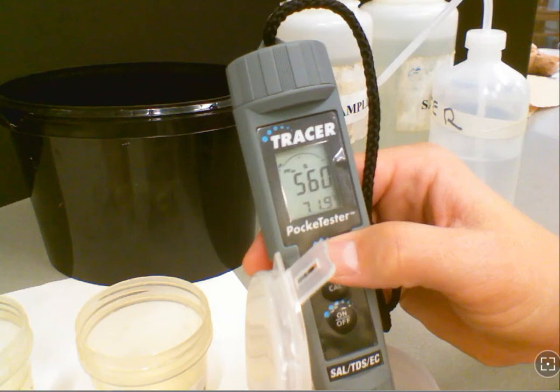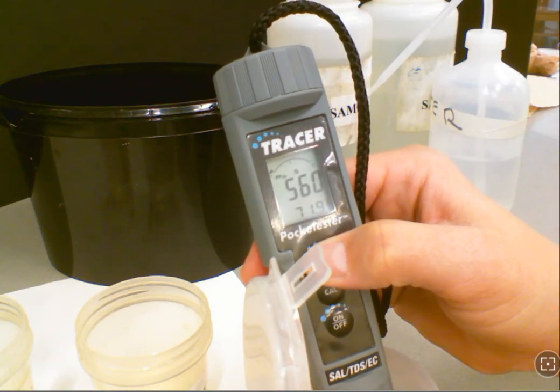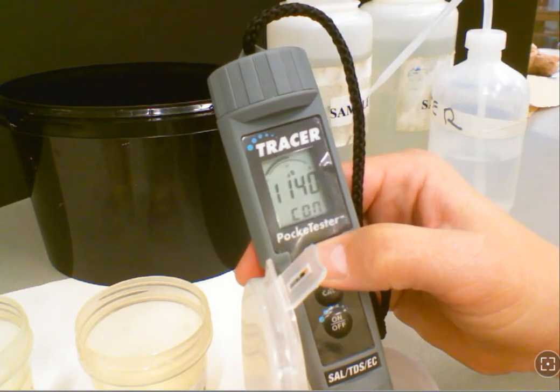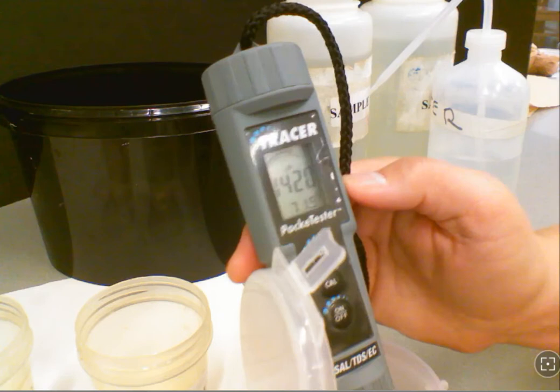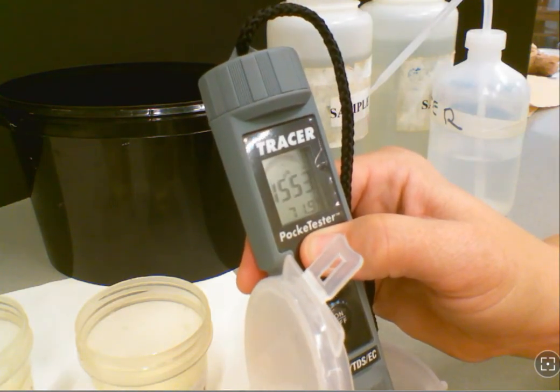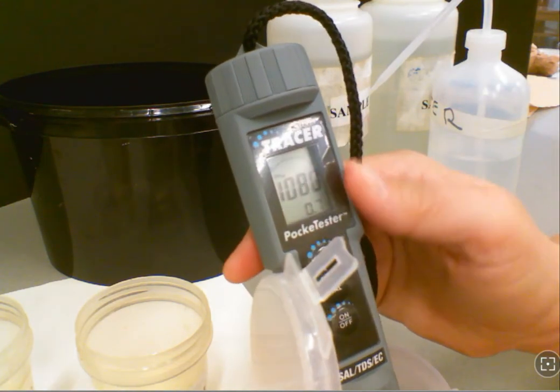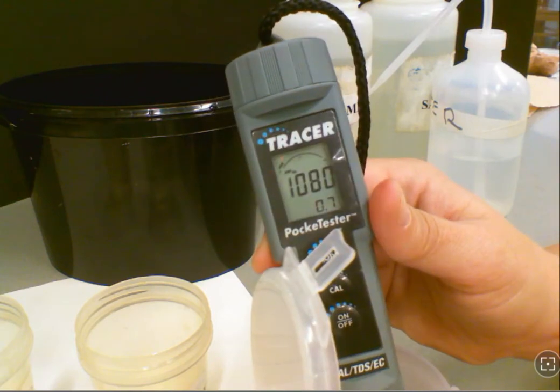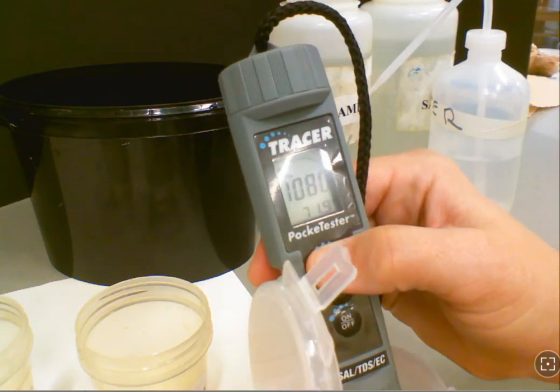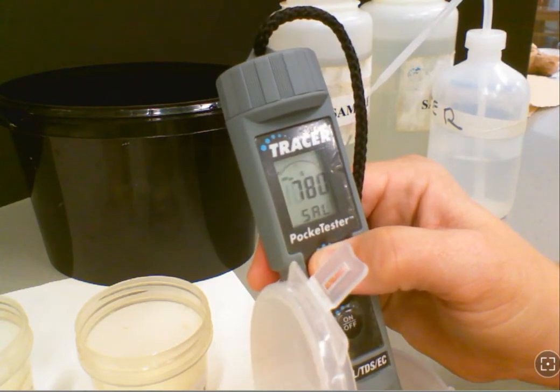If it's TDS, you only have PPM. You would click that mode button to move through. And then finally for conductivity, you'll have the µS. Conductivity is what you want to calibrate it with.